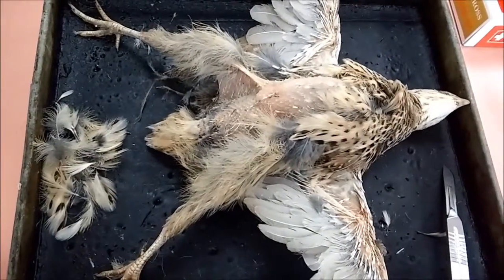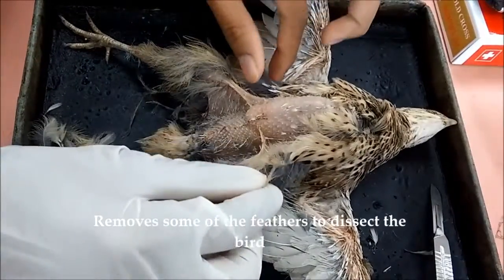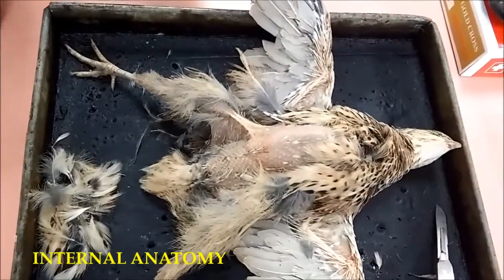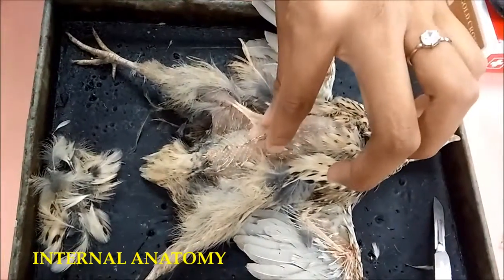Okay, after we remove some of the feathers and hairs in some part of the birds, we are going to see the internal anatomy of the bird. So first we need to cut the layer of the skin.